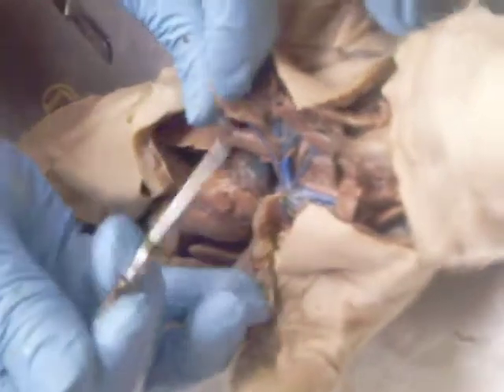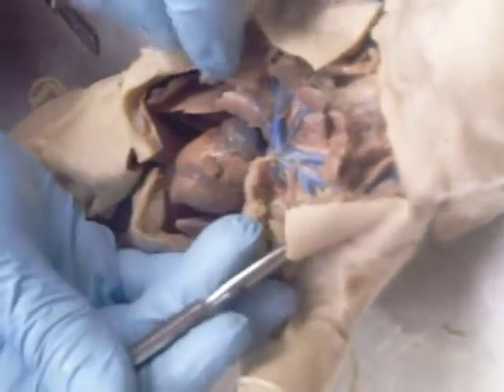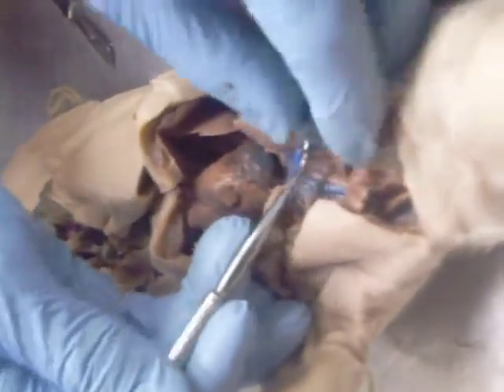Then, if you watch, it will turn here, go into the right arm. So at that point, that's the subclavian vein. How about the thin one right here? Let's just focus on the main ones. You don't want me to name that one, huh?